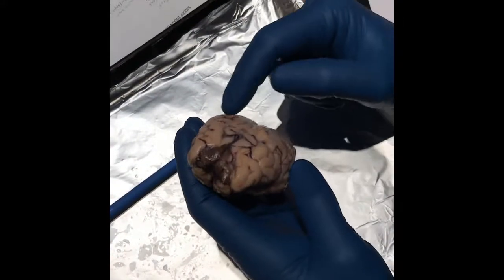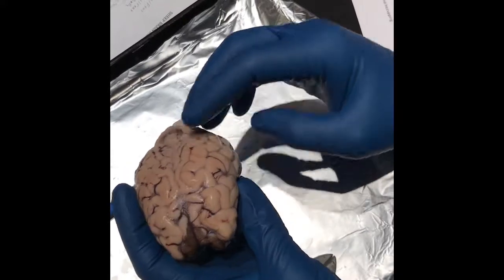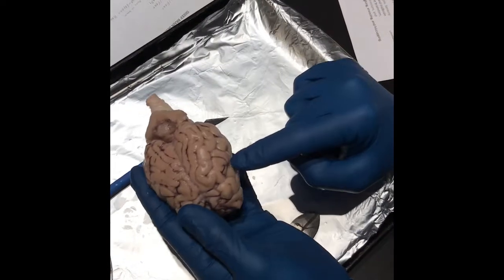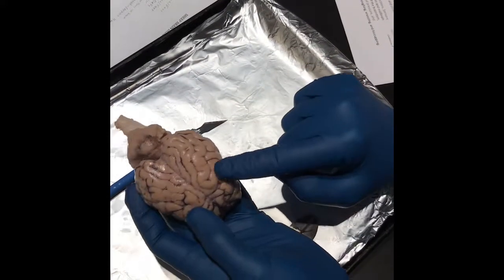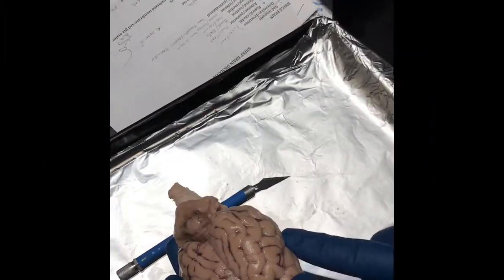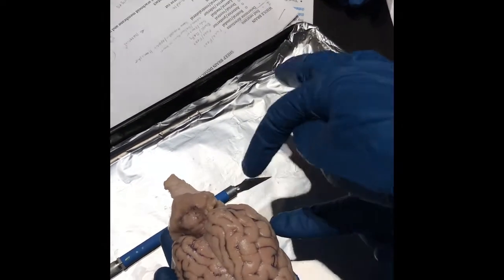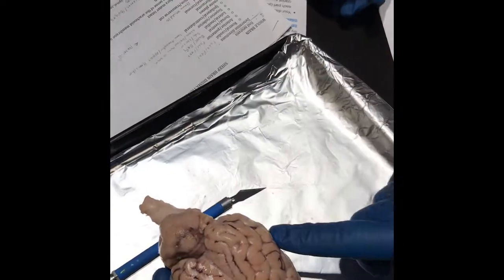Here, identifying the forebrain. And there's that line that goes right here, this is where your primary motor cortex was. It doesn't go all the way down. You see it's got the little grooves there and there, but it doesn't go all the way through in a sheep brain. Sulcus is the small grooves, and the gyri are all of the different lumps. And this over here between the cerebrum and the cerebellum is the transverse fissure.